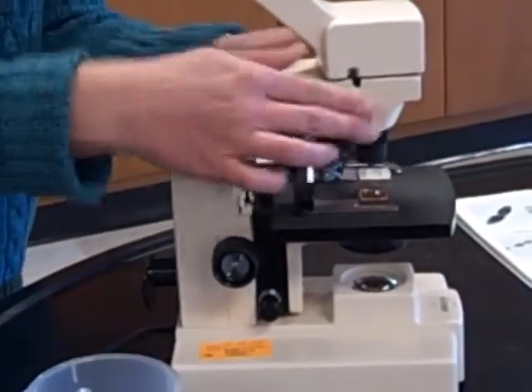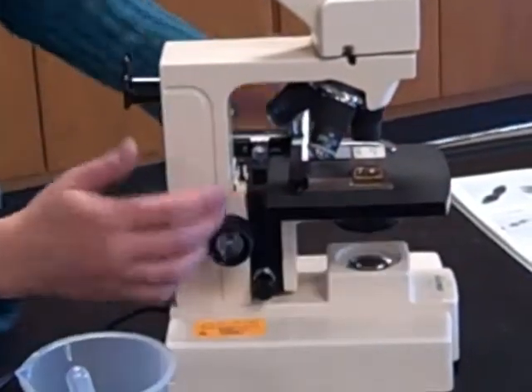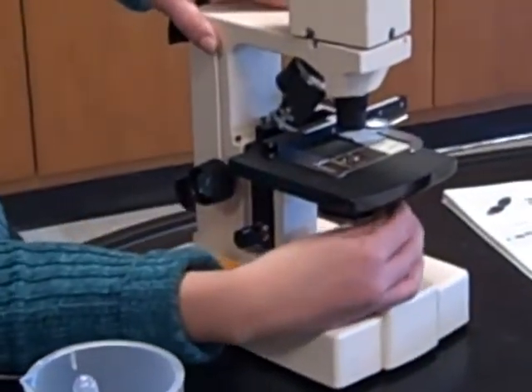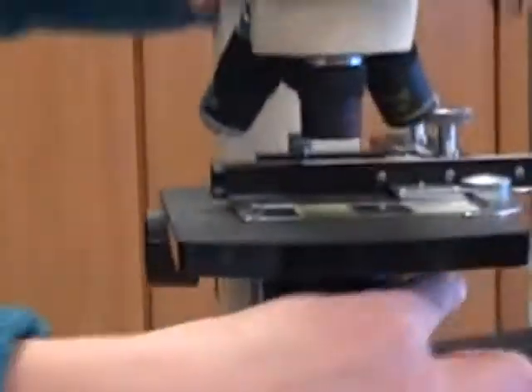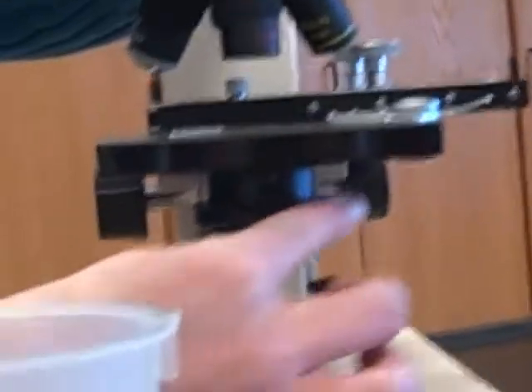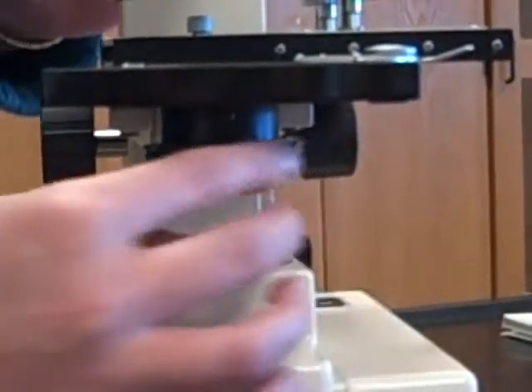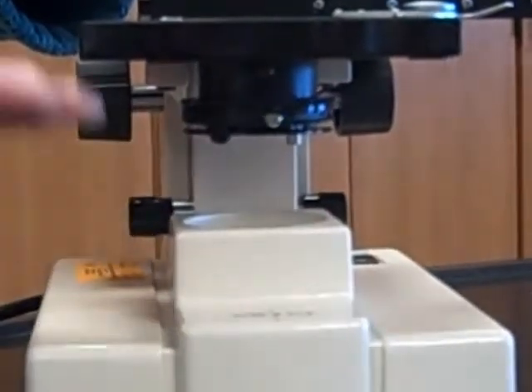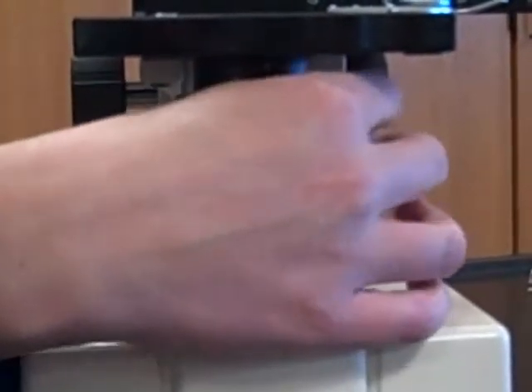You have your stage. If you look under your stage, you'll see a lever here that you can move back and forth. This is the iris diaphragm, and it controls how much light passes through your stage. We'll talk more about that later.